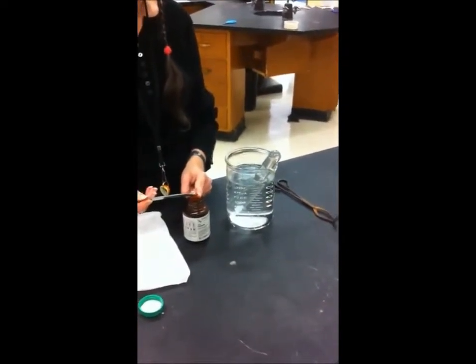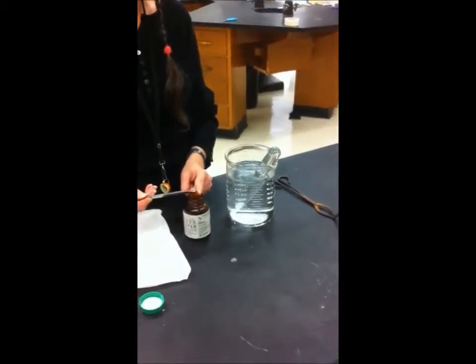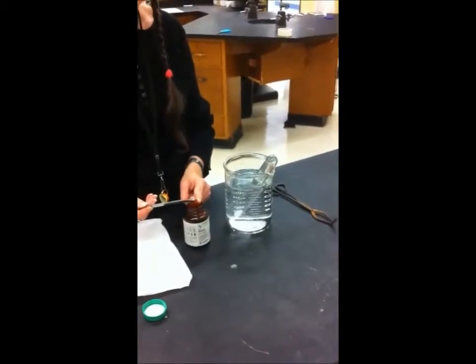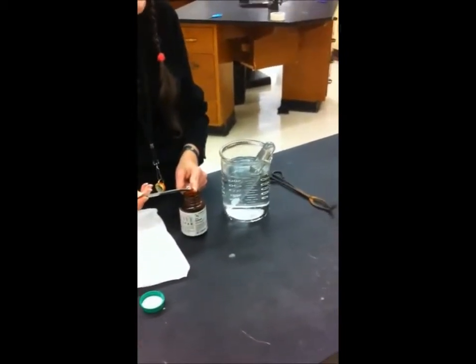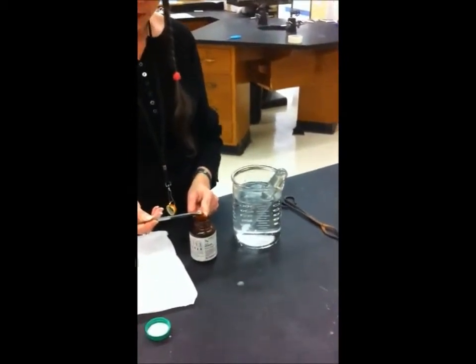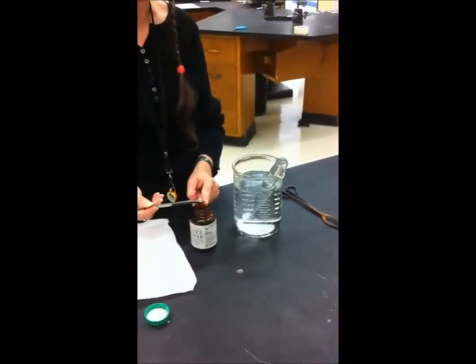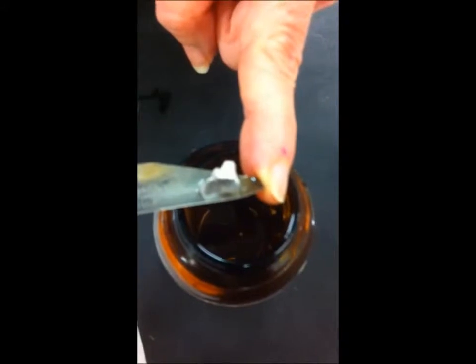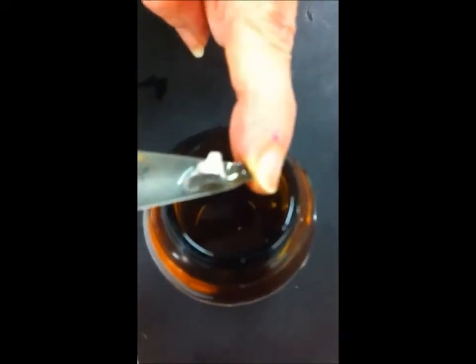The question I asked was, what gas is being produced? And I found out it was hydrogen gas, and so I'm figuring out where all of the products are coming from. Zoom in, if you will, on the sodium, and you can see the sodium metal is real shiny where that recent cut is. I'm just going to use this very small piece of sodium.